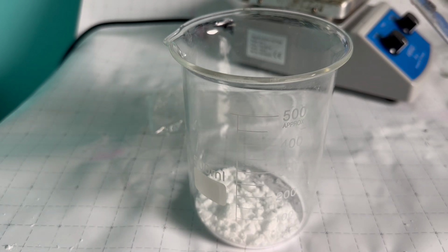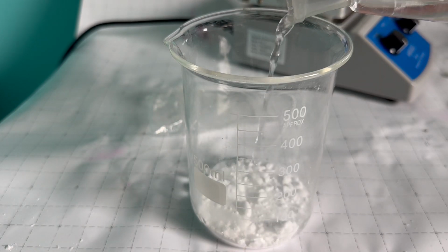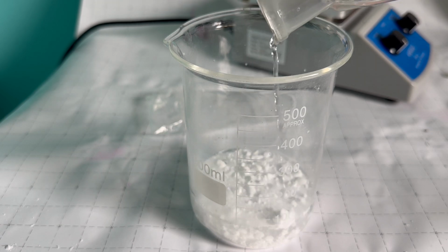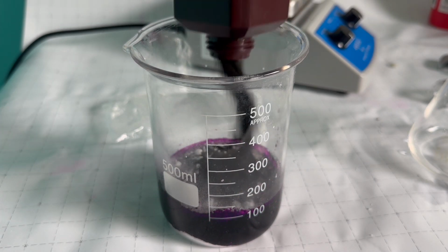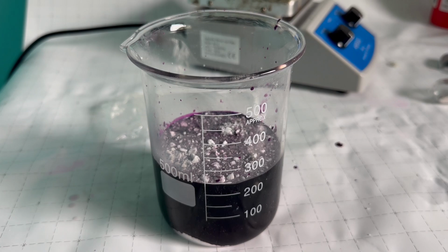Then I introduced into an Erlenmeyer flask exactly 98.58 milliliters of the chemical hydroxylic acid. Its pH is so high it's even higher than concentrated sulfuric acid. I then dumped in 100 grams of potassium permanganate. Afterwards, I used some water to dilute the concentration of hydroxylic acid.